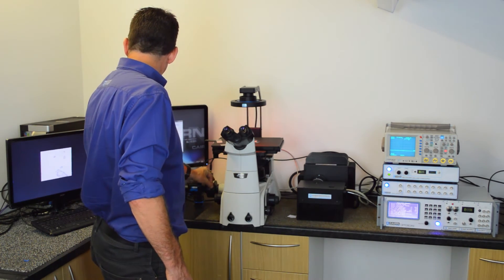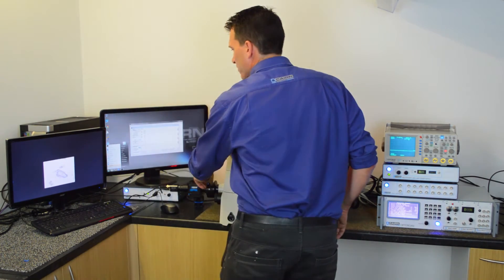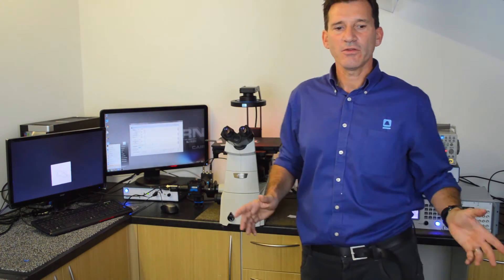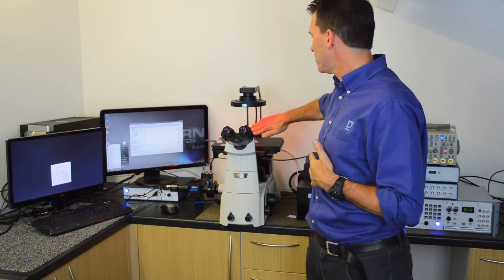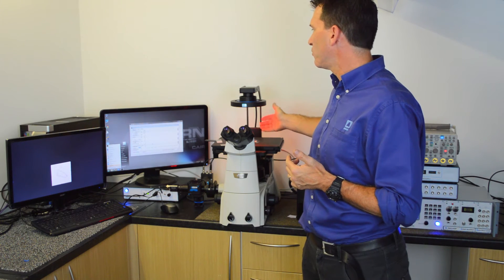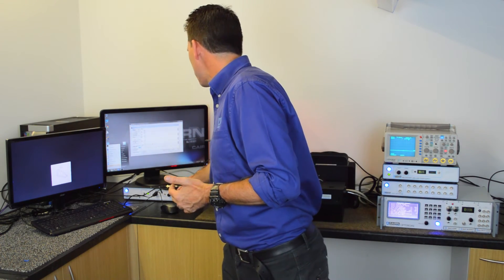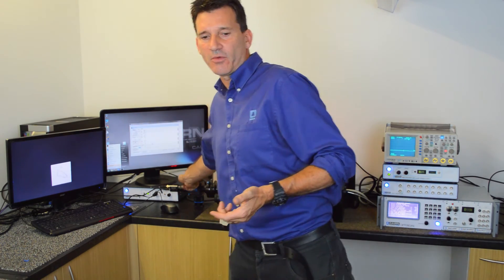We have a variable rectangular aperture on the output of the microscope and all we do is literally delimit the area that we're recording from. In order to know where the photomultiplier is precisely recording from, we use red illumination — in this case the Cairn Aura phase illuminator, but it could be a red filter in the standard bright field pillar. The red light passes through to the camera and the green-yellow fluorescent light is reflected back to the photomultiplier.